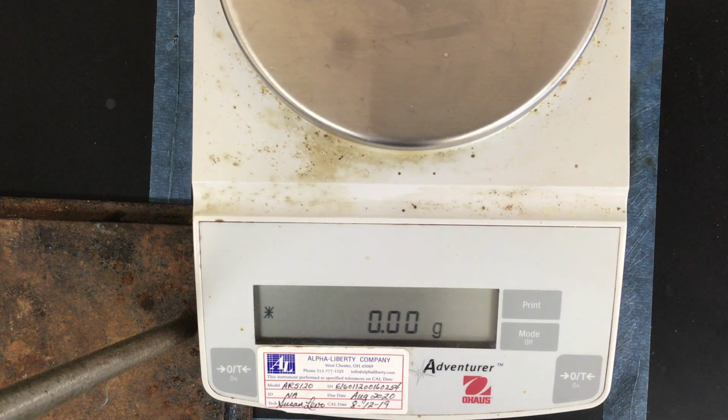All right, everyone, so I'm going to go through the mole calculations lab. The handout that you will need is on Schoology. You'll need that to record observations as well as measurements as we move through this.